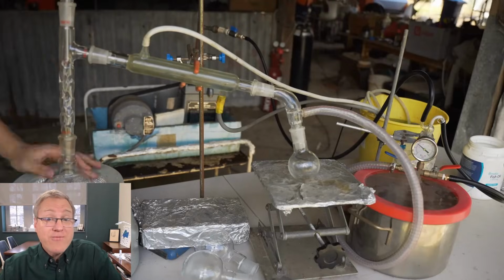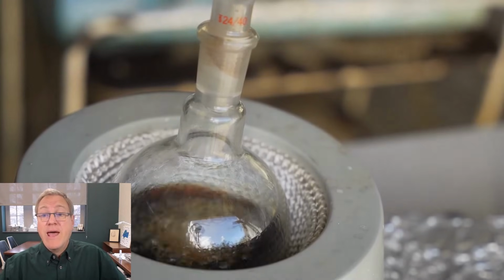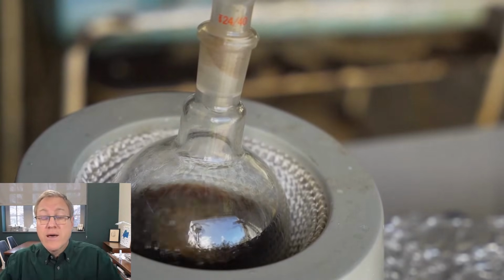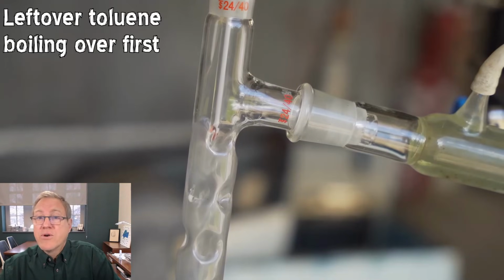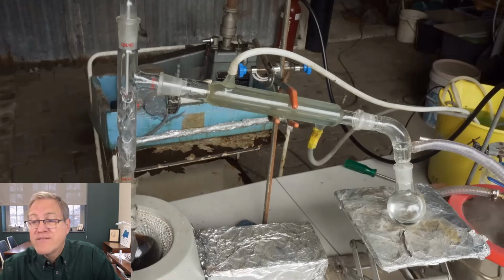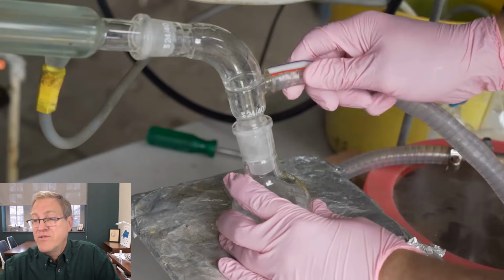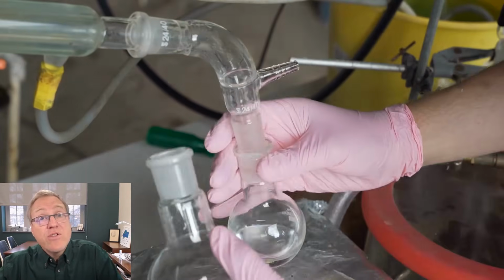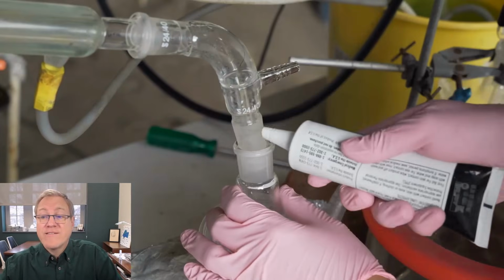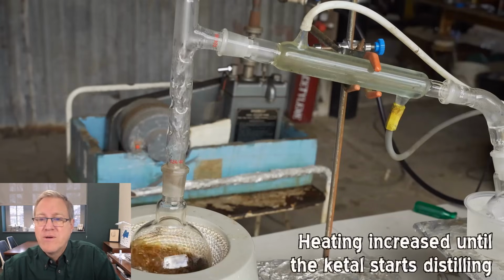So now the flask on the left ought to start boiling, and he'll see bubbles. There are the bubbles, and that vapor will rise. Look, he's seeing it. Now he probably has a little leftover toluene. That's okay. He'll collect that toluene in his receiver flask. He's monitoring the temperature as he should. Collecting the liquid. You can see it on the right. Now he feels he's done with the toluene, so he'll swap out receiver flasks. And again, using a little grease to make sure everything gets sealed.